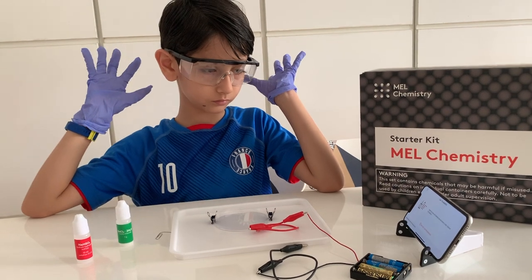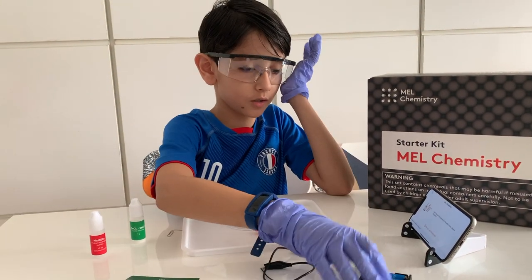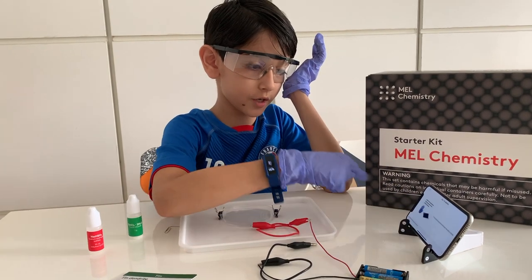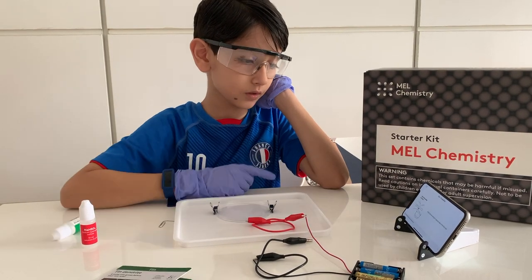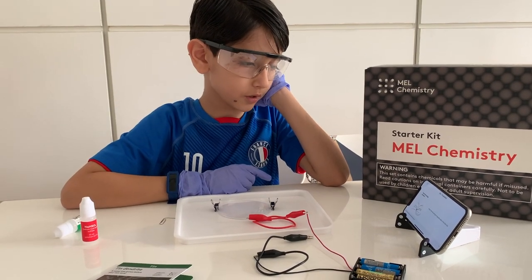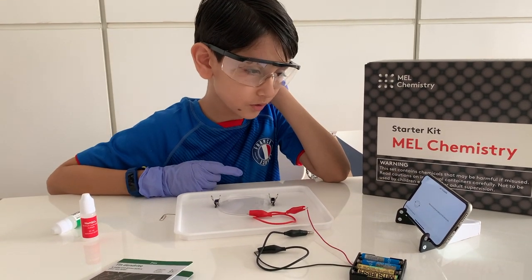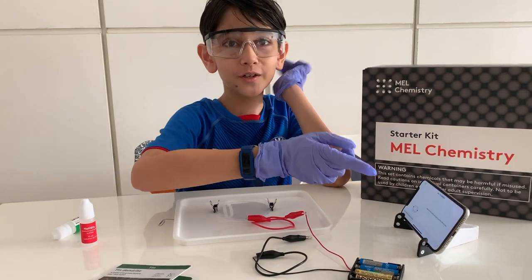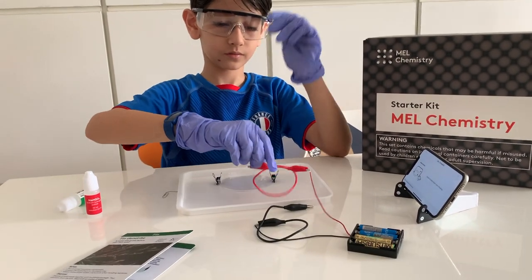Okay, let's get going. I'm so excited about this, champ. We've already added the batteries, which is the first step. Second step: perform the experiment. Third step: secure the clip-ons — we don't have springs, so that's done. Attach wires.